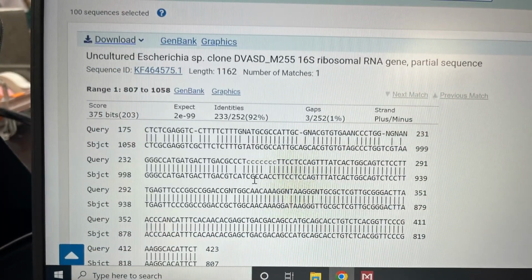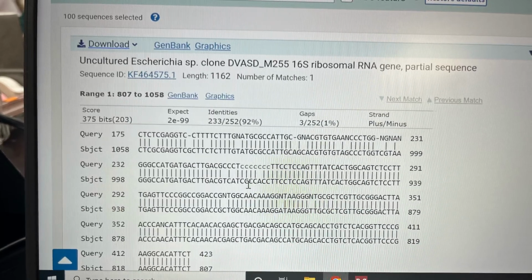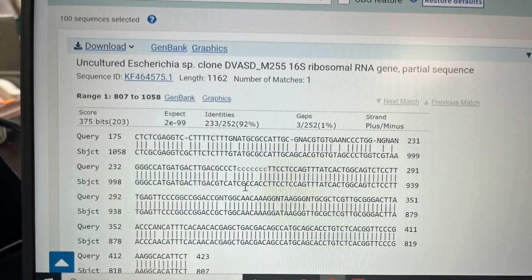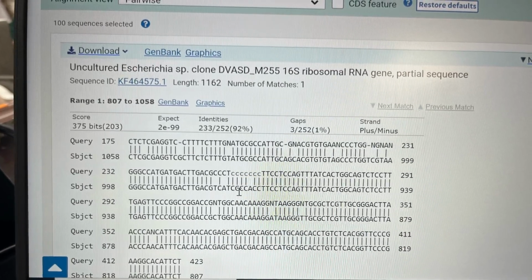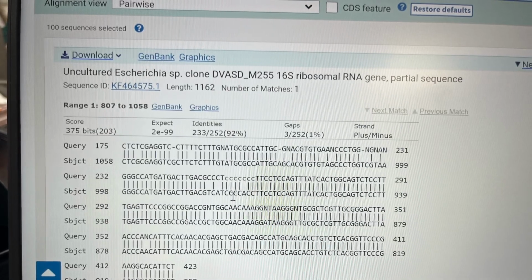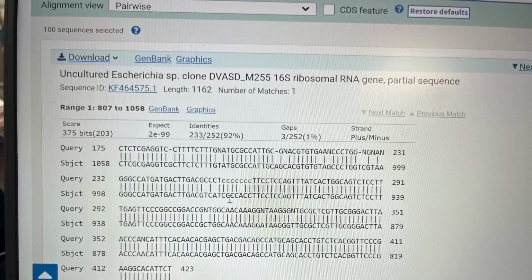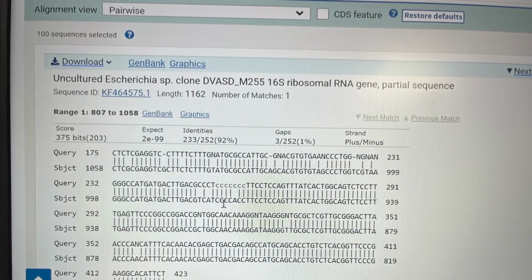And at the very beginning of your sequence, you should see a lot of N's and a lot of noisy peaks, because this is where your primer sat down. Then you're going to delete these noisy areas up until the point where your bases are nice and clean to call. Once you have cleaned and edited your whole sequence, reverse it if it is a reverse sequence and add to alignment. Then check with your instructor if you need more assistance for this part.